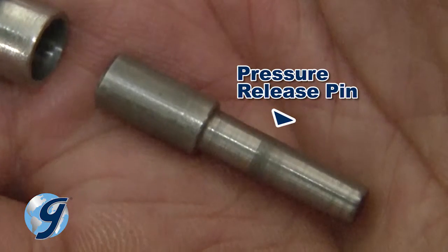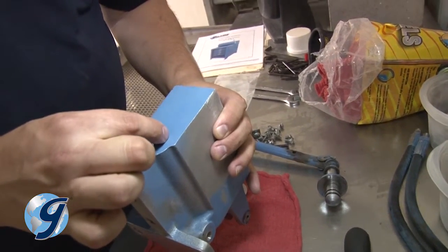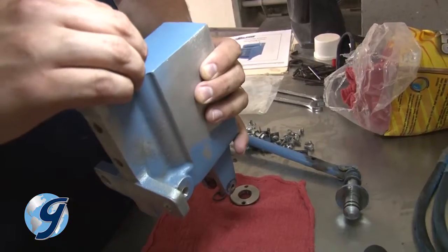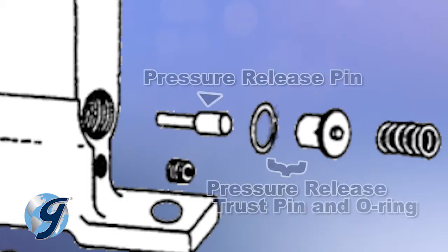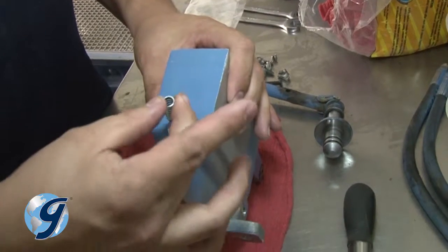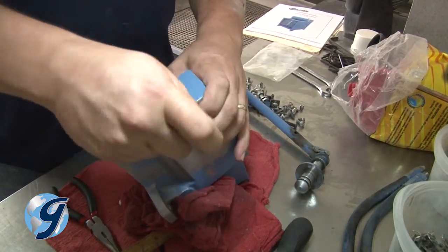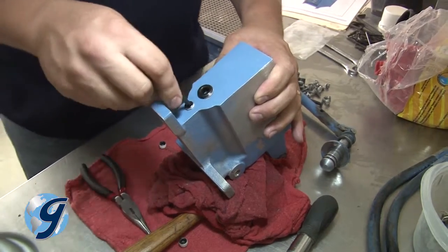Now insert the smaller portion of the pressure release pin into the pump housing. Next, fit the O-ring on the larger diameter portion of the pressure release thrust pin before inserting it into the pump housing around the smaller pressure release pin. The cone-shaped spring is then installed with the narrow end facing inward toward the pump body. Finish by installing the new plug. Now, reinstall any remaining plugs.